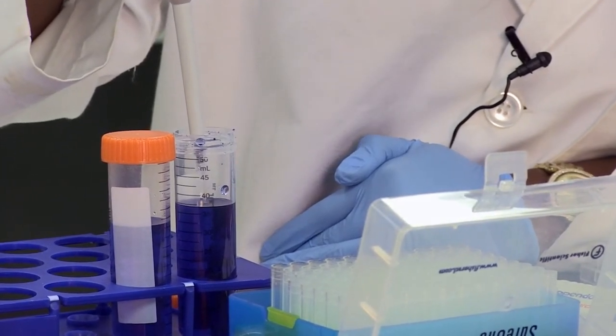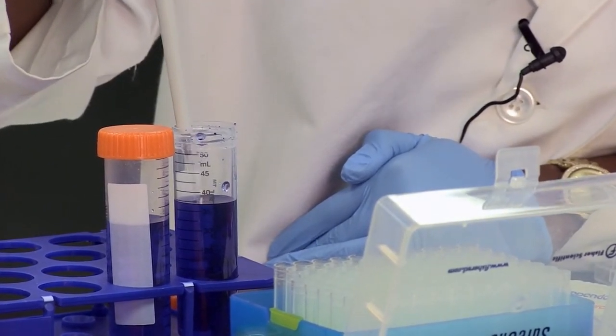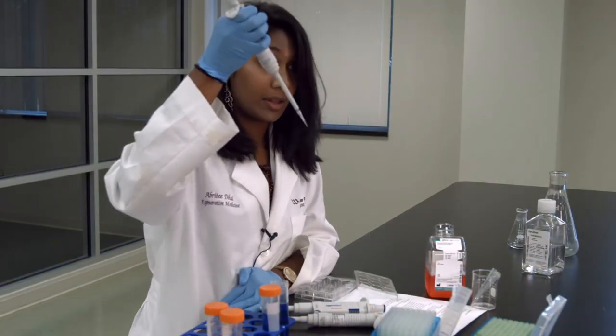Then, at that first stop, you pull the liquid up. Now you have 5 microliters.